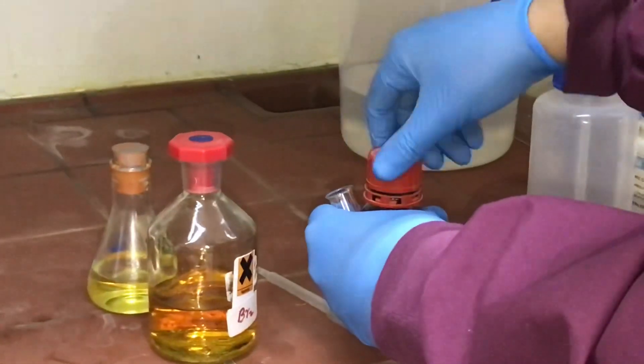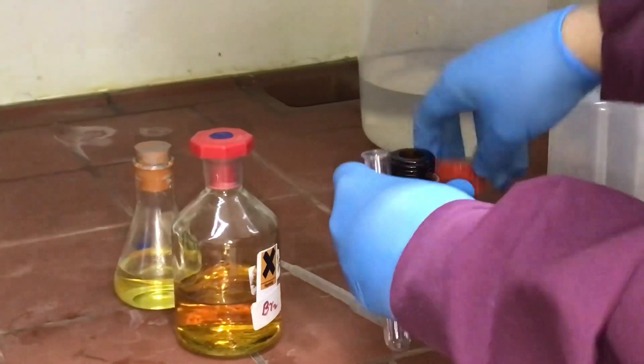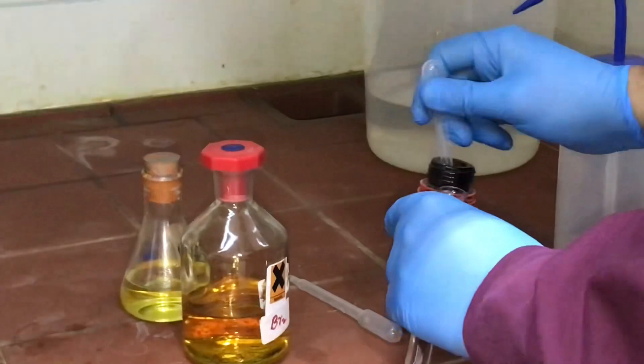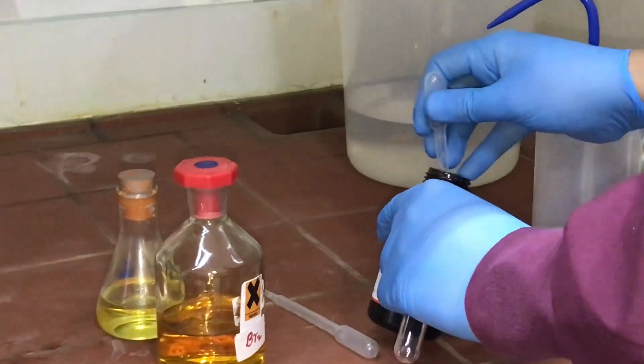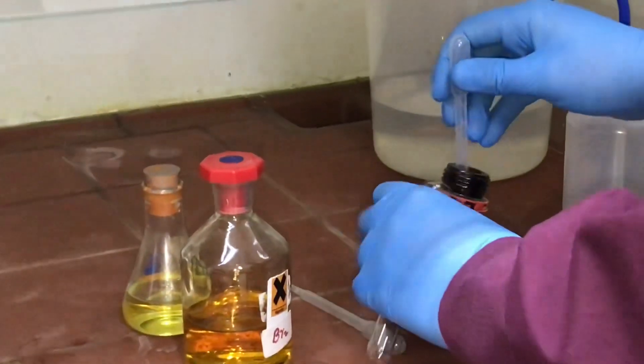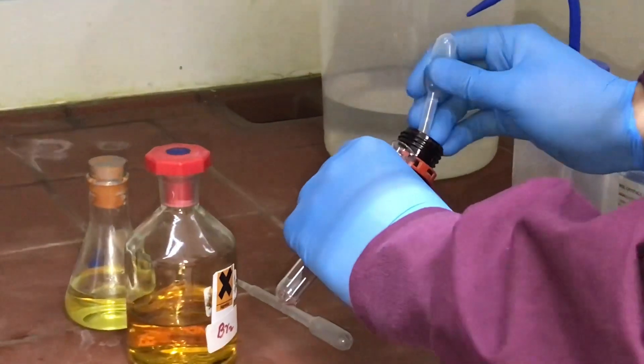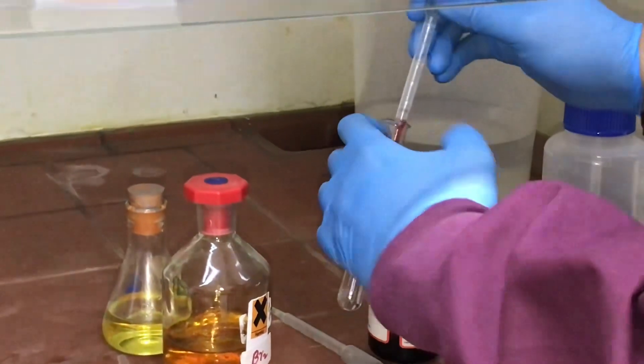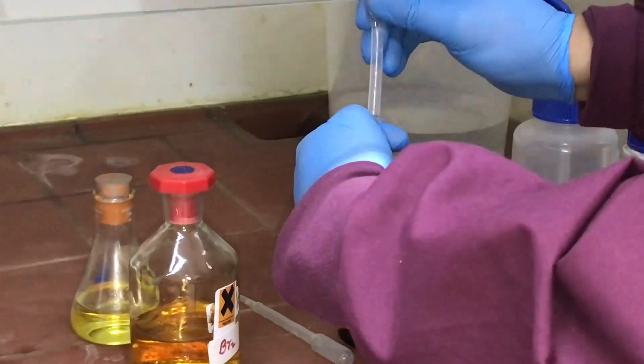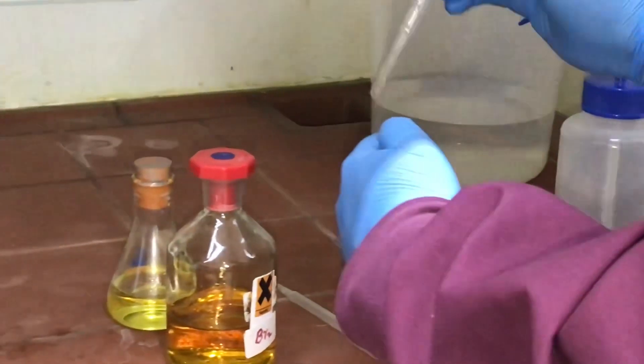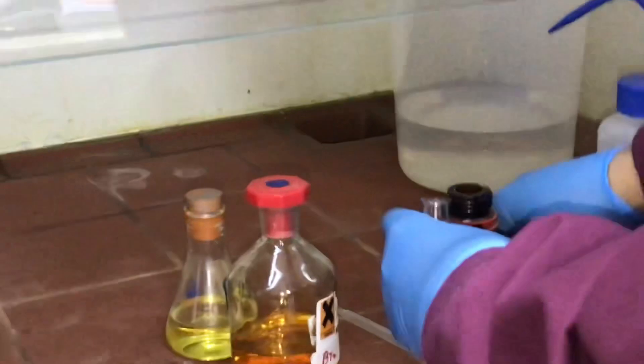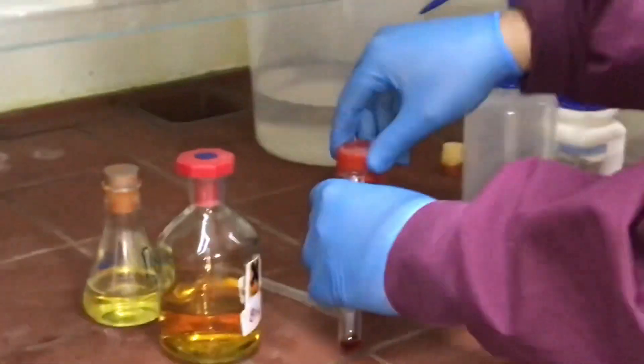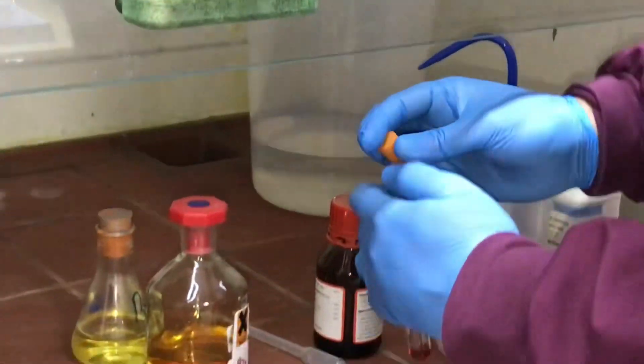We have assessed this for health and safety reasons. So we've got some of this liquid—this liquid is actually the phenol that has dissolved in the water it's absorbed from the atmosphere.